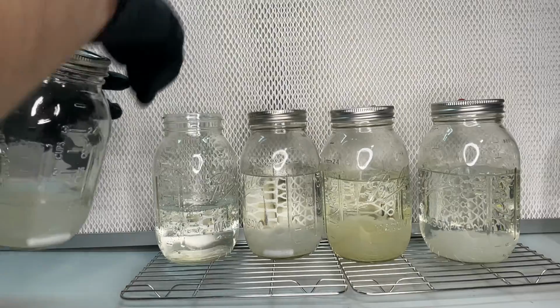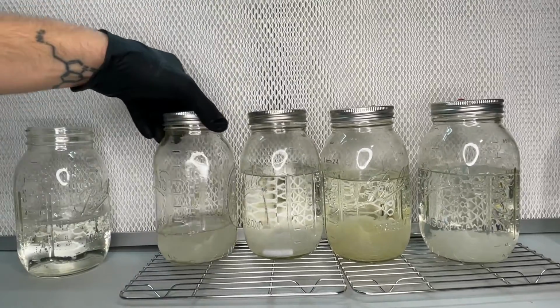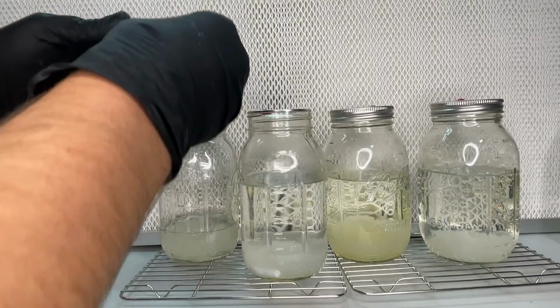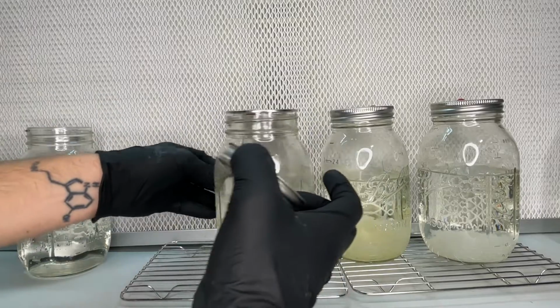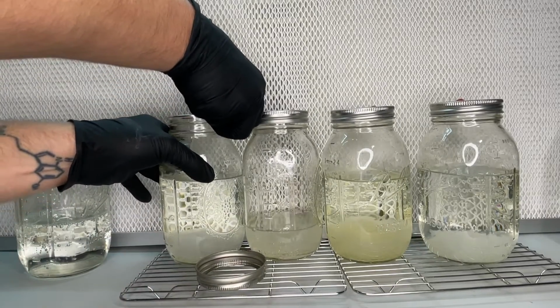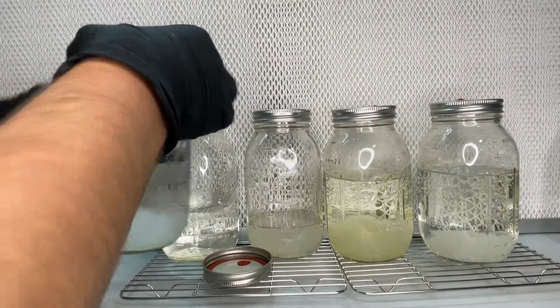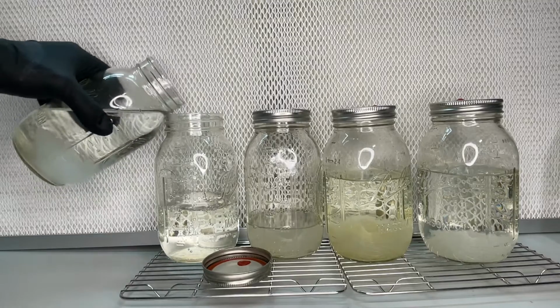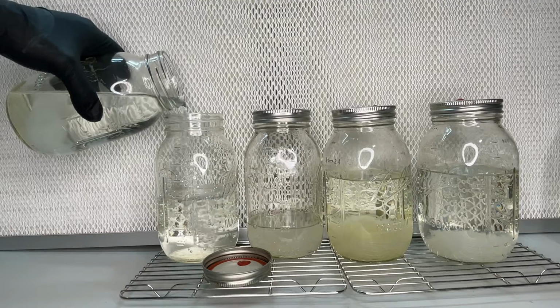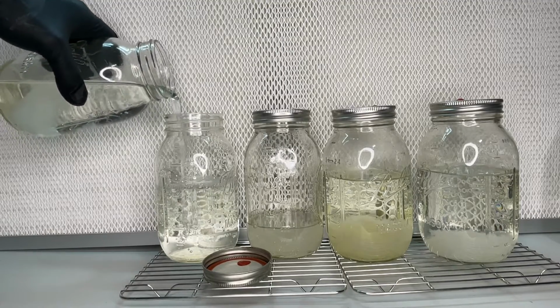As always, it is risky to open the jar lid, so I'm doing it in front of a laminar flow hood, but you can do it inside of a still air box or while working under a Bunsen burner flame. Additionally, I wear gloves and a mask, and I wipe everything down with isopropyl alcohol.